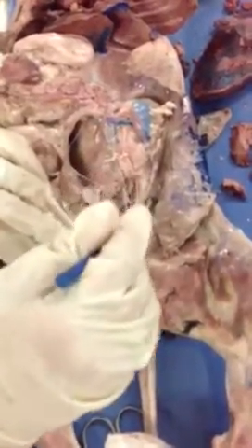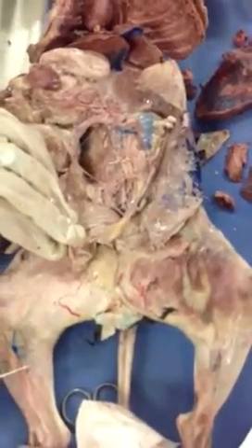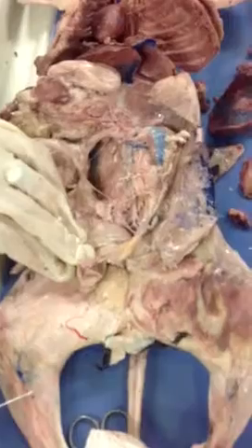Like femoral? Oh, you have to read it. External iliac? Well, there's caudal and then there's femoral artery. And then the right and saphenous. Left external. Yeah, the first one, please.